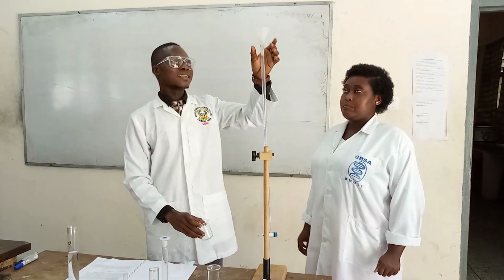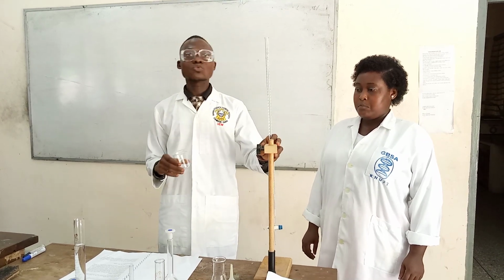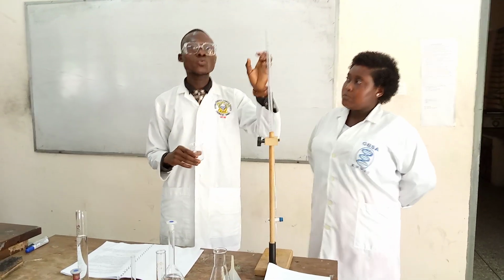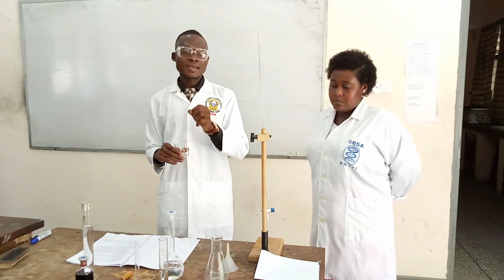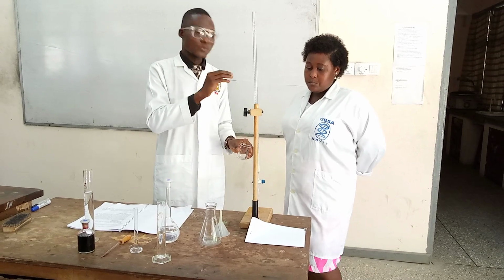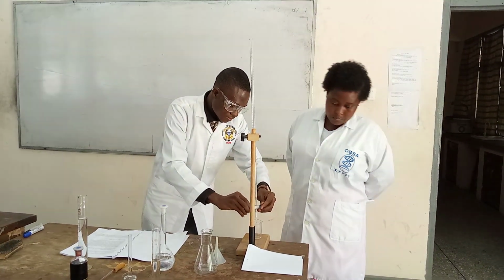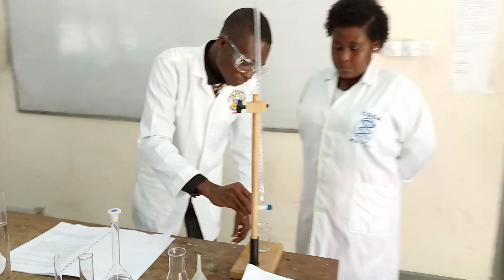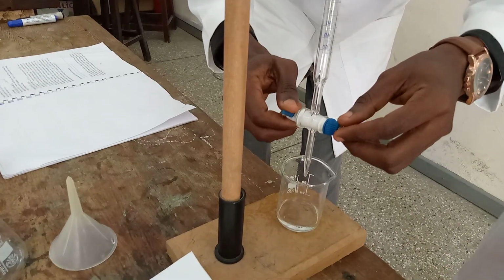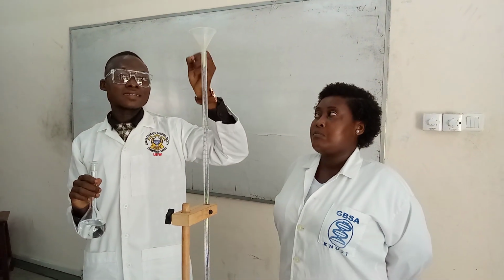And please, guys, before you do that, that is how titration is always done. You have to pour a small sample of the solution you are going to use for the titration and use it to wash the burette first, because you don't want the solution to be contaminated. So that's why I pour a small amount of the EDTA in the burette. It means I'm done. Then I will now fill it up, so there's no contaminant in the burette anymore. So I'll now fill my EDTA.